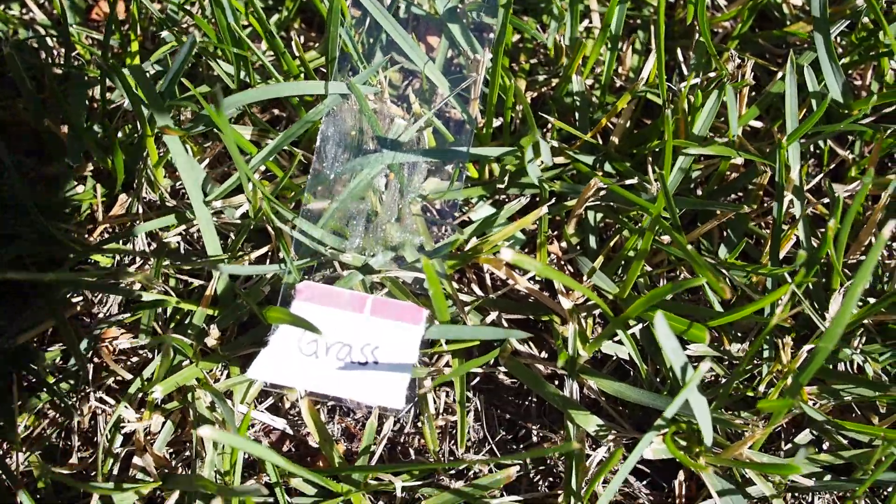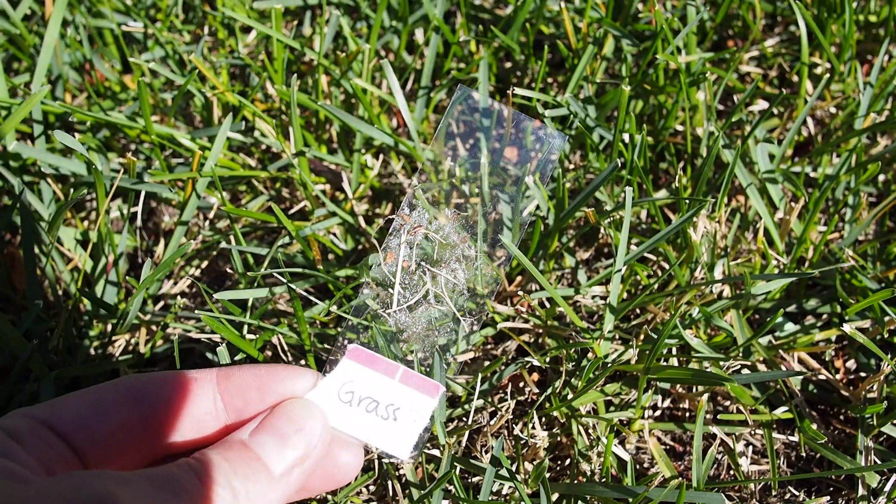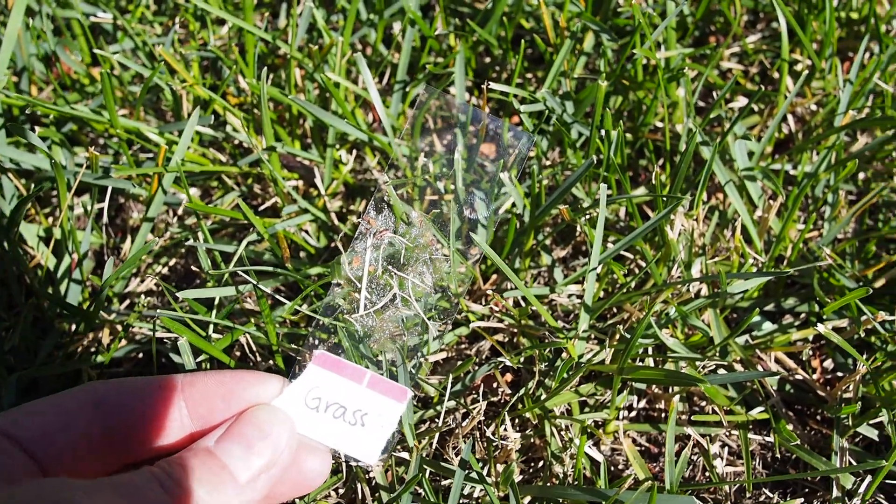We also sampled some of our grass. Here you can see some of our grass samples under the microscope.